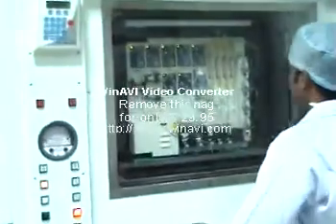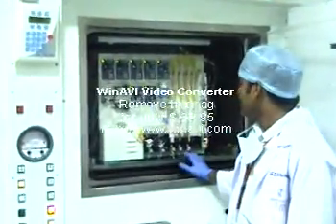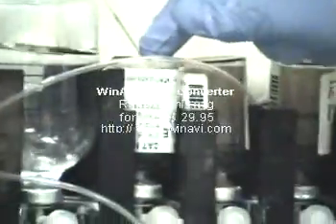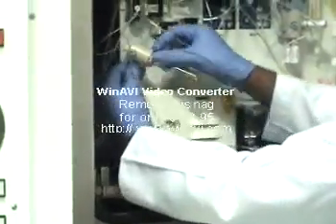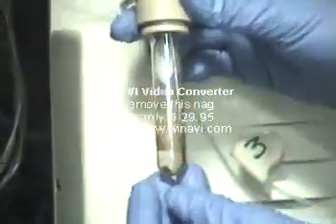This is our chemistry module — the module we use for converting fluorine-18 to fluorodeoxyglucose. Let us go part by part. There are 5 reagents here: water, acetonitrile, mannose triflate, Kryptofix, and hydrochloric acid. And this is the reaction vessel — all the chemistry takes place in this reaction vessel.